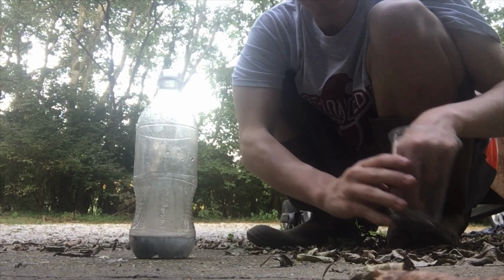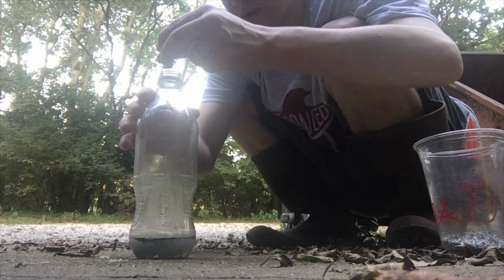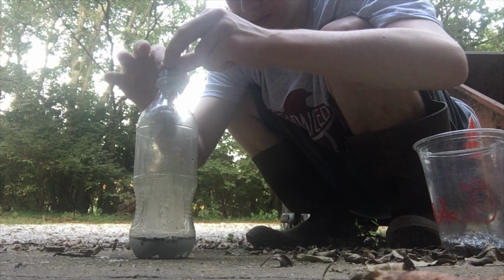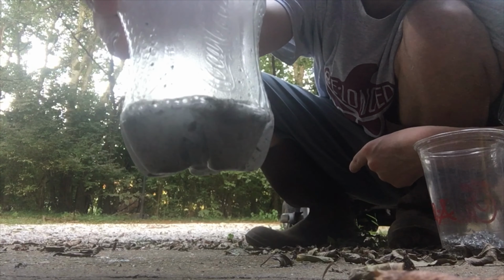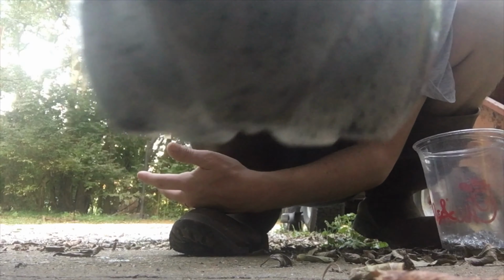So we're just going to put a few more of these shavings in there, and then we'll end the video. So let's see if we can just go on in. Just look how quickly that reacts, almost instantaneous. You can kind of hear the hissing of it. I don't know, because my camera is over here and my speaker's over there. Hopefully you can hear that hissing sound.